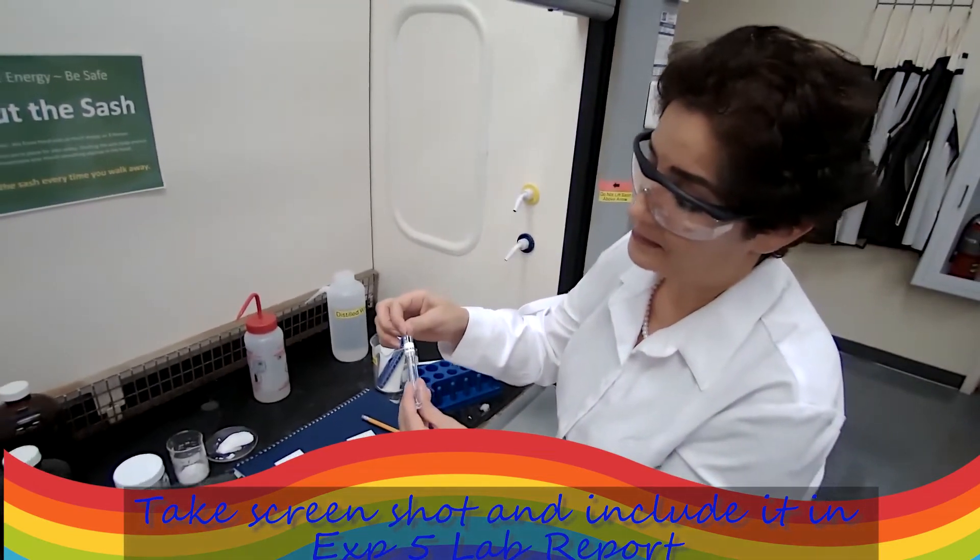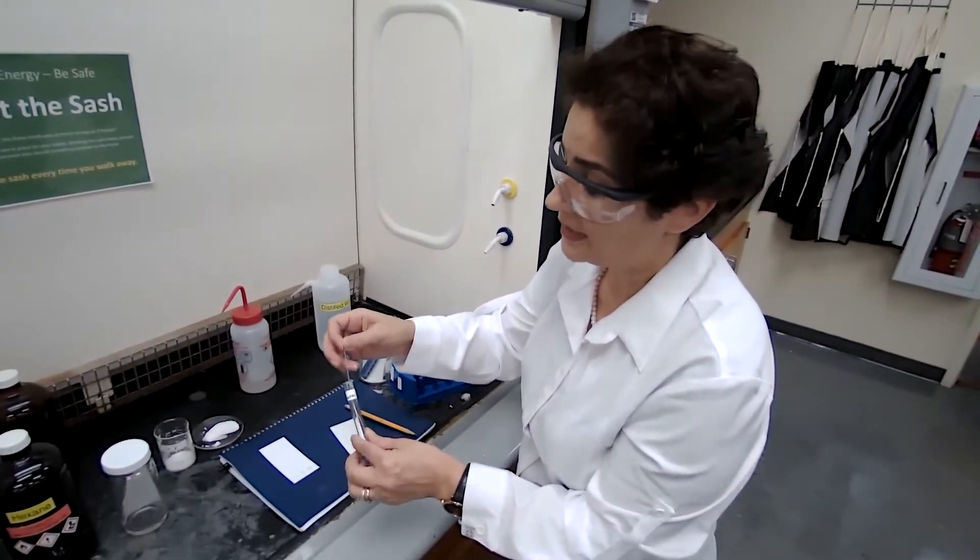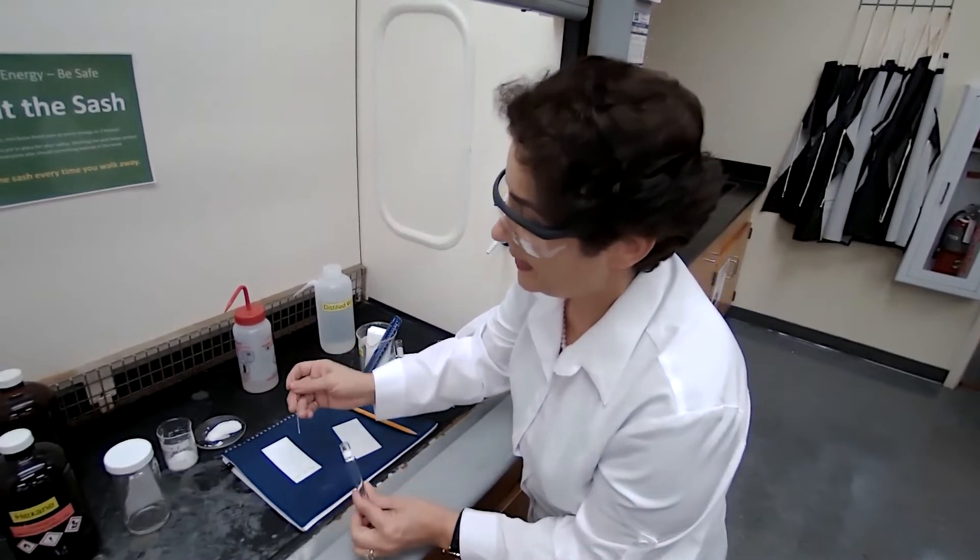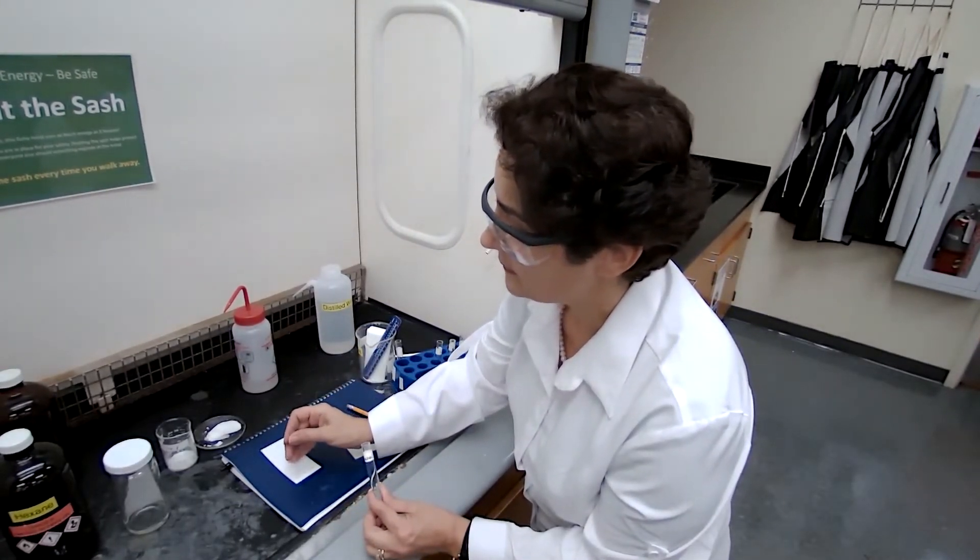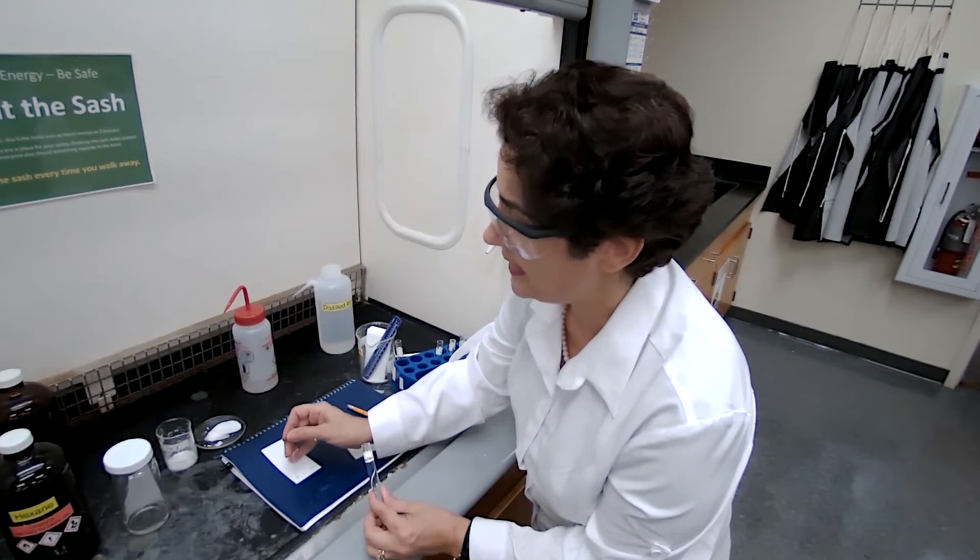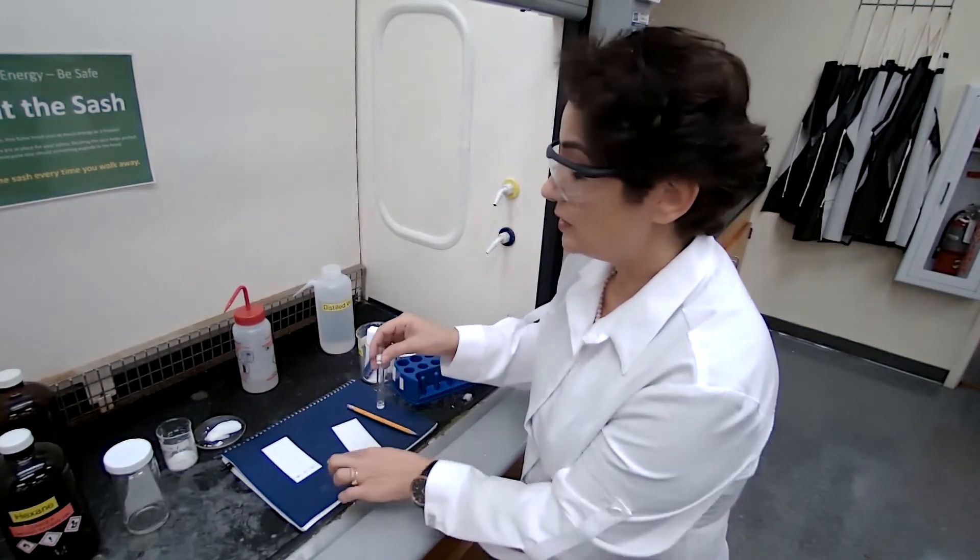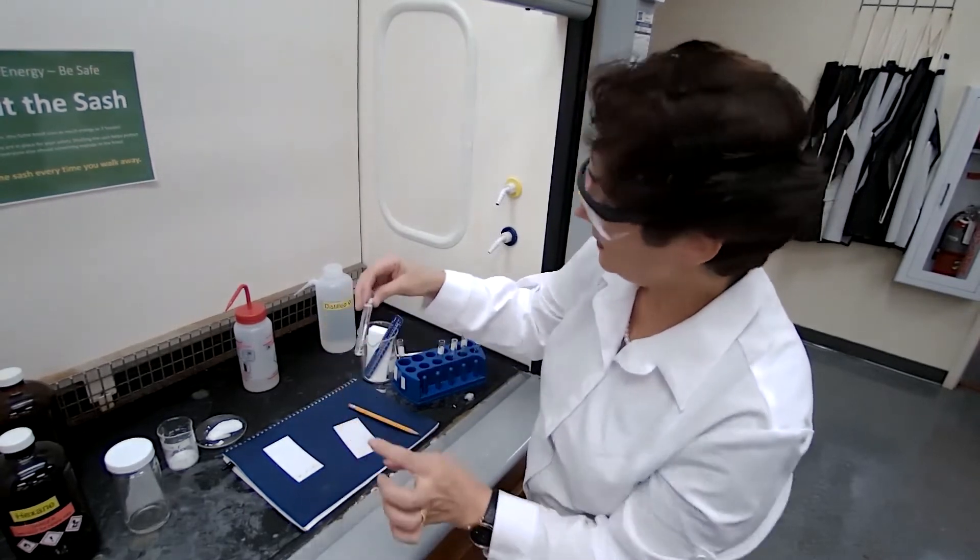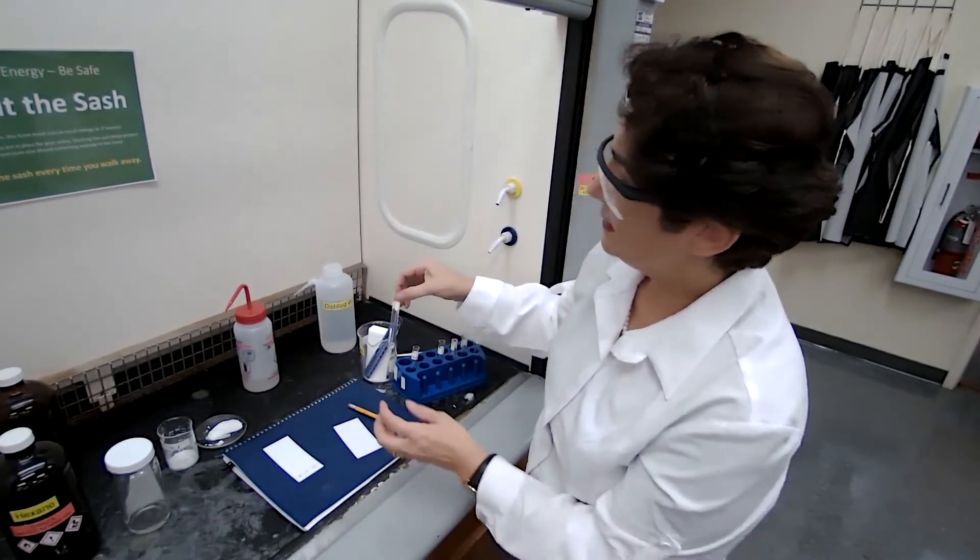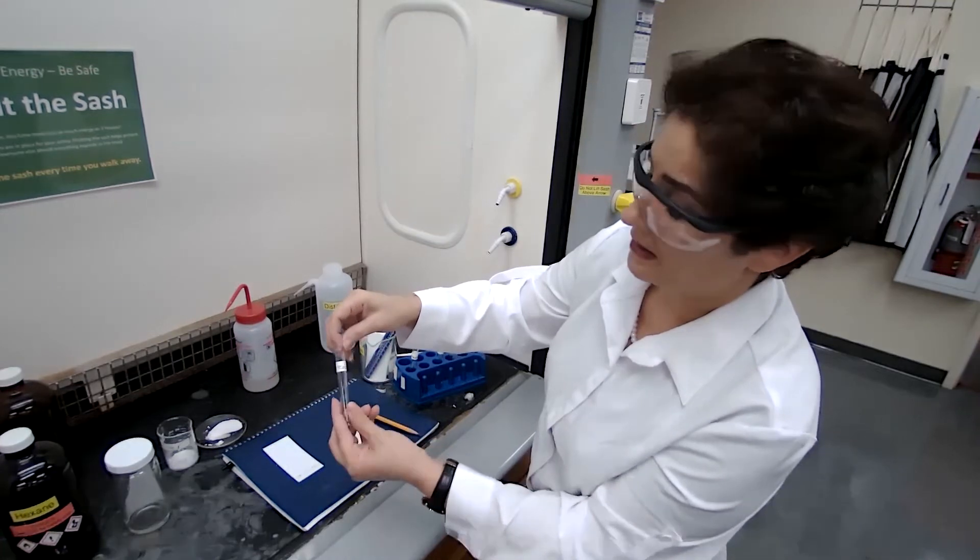I'm not sure if your sample has impurity or not, so let's try it. But in case if your sample is pure and doesn't have impurity, we want to make sure that we see the difference between the pure sample and the impure sample. So the neutral compound goes on N. Acid, I place the acid on A.